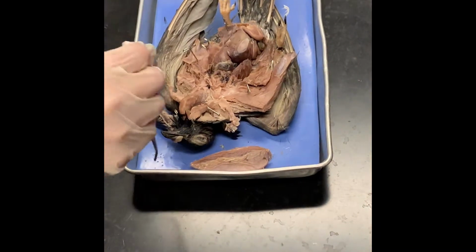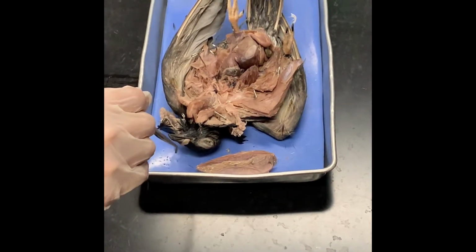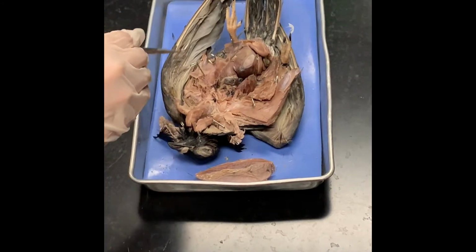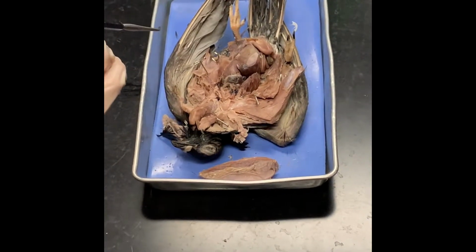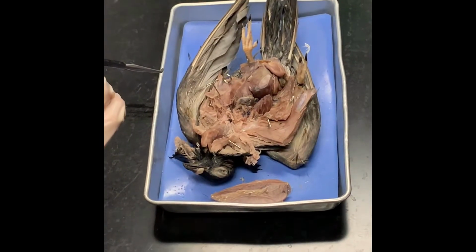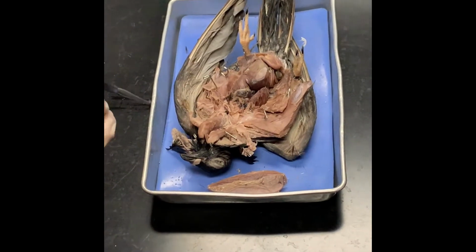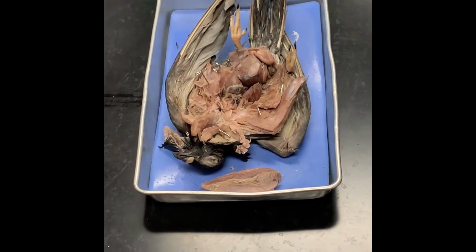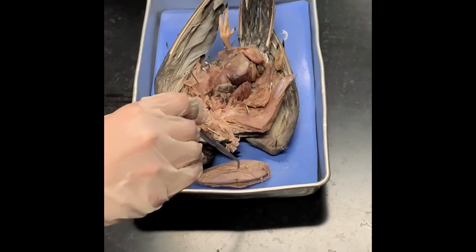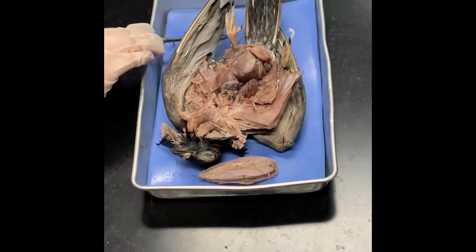All right, so this is our starting pigeon group. Externally, there's not really a lot to see, except we pointed out the wings and the feathers. Obviously, you can see the wings and the feathers, but I guess the questions are, what do we remember? What are the wings derived from? The forelimbs, the front limbs, right? And then the feathers, what are they derived from? Scales, right? So that's it, externally, for the pigeon.